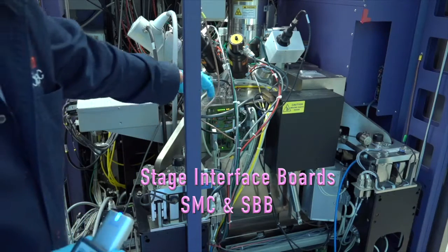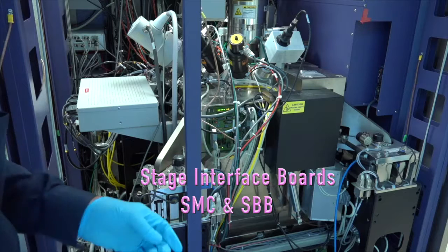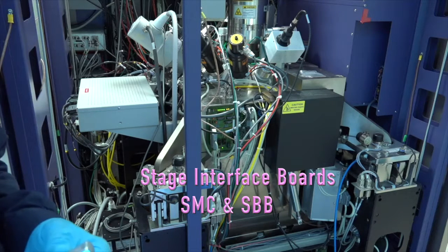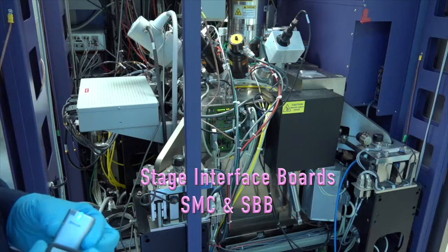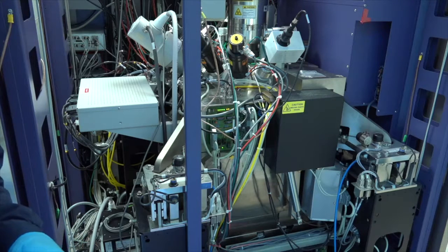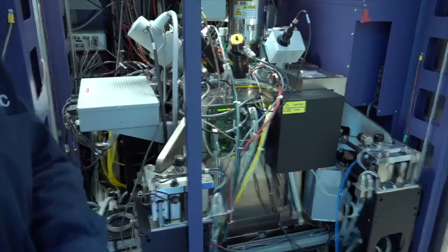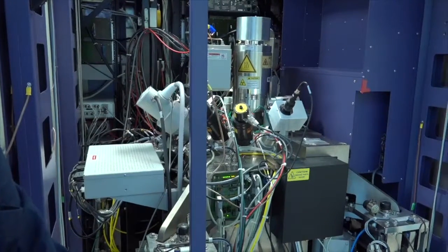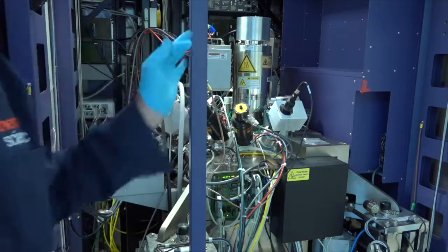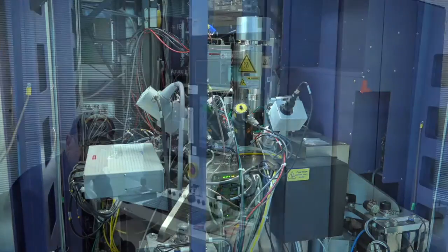It's got a number of LEDs on here that tell the stage whether it's at home or not. And the encoder signals are brought out, and we can measure those. If I get a chance in a second or third video, I can show you how to test those signals. I'd like to do that. You also get a little better perspective on the columns here. Okay, the E column is here. See if I can tilt up with the... okay. So I column here, E column right there. So you can see how they're mounted on the vacuum stand.